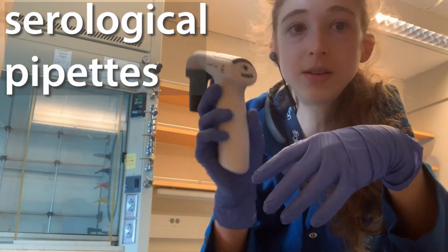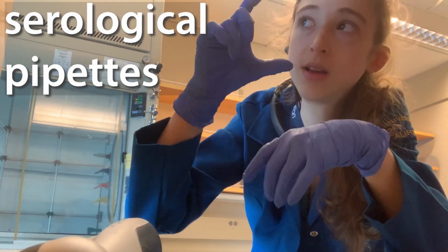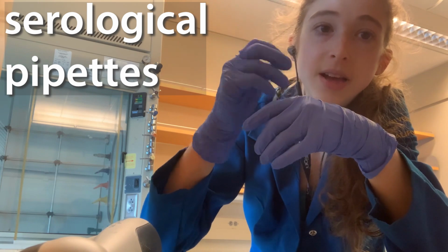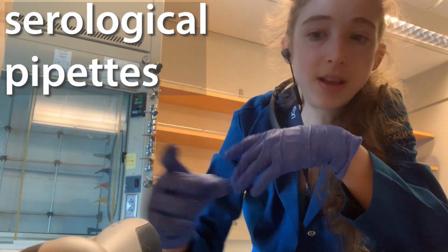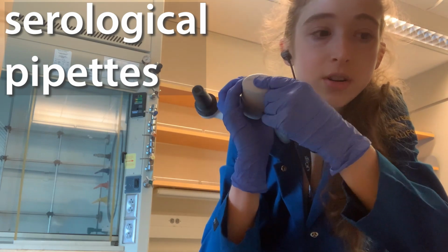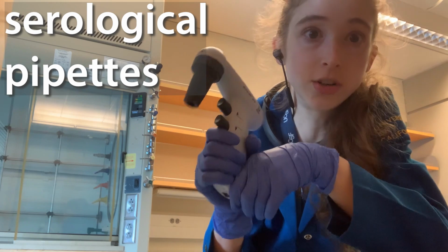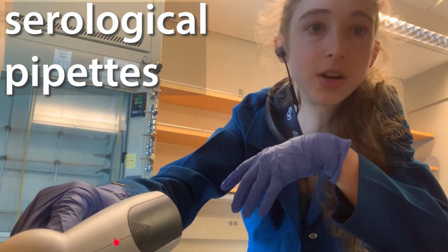So if you're lucky, you'll have one of these that has this feature. There are also the ones that you basically dial up and down, instead of being battery operated. Speaking of battery operated, make sure you charge them, because it's awful when you're in the middle of the experiment and it runs out of charge.